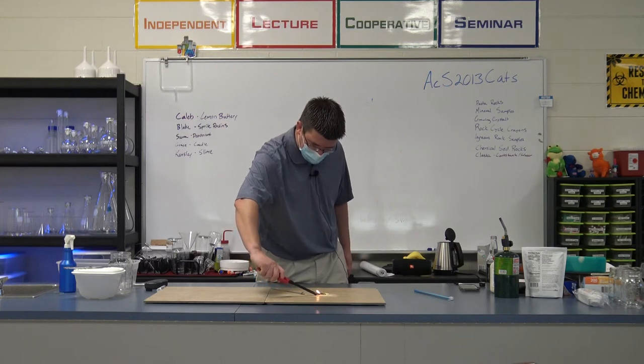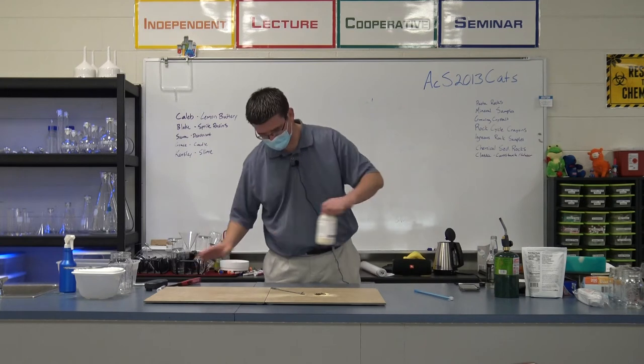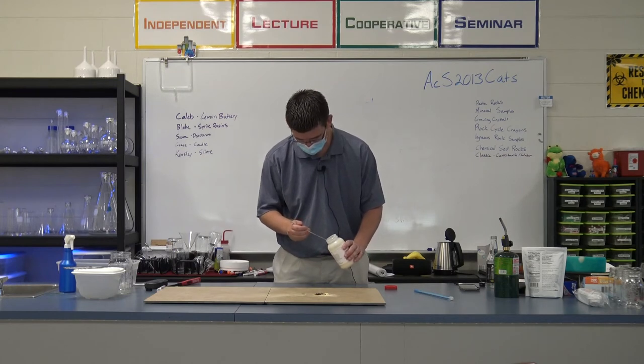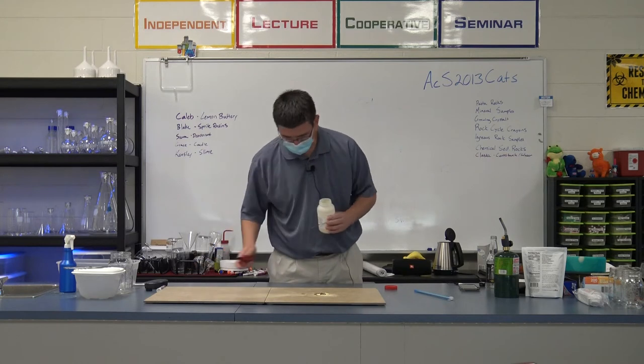Do I have enough left to light here? I guess not. Let me make another little pile and try it again. Let's try. Oh, it's burning a little bit, but not much. Let's add. Oh, it's about to go out. There we go. We'll give it a little bit more.